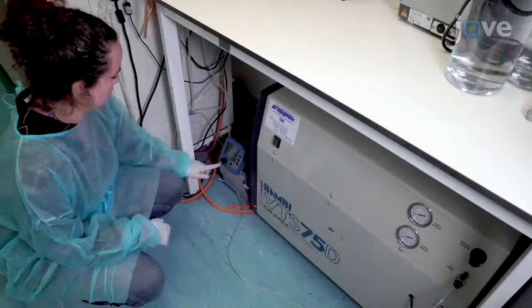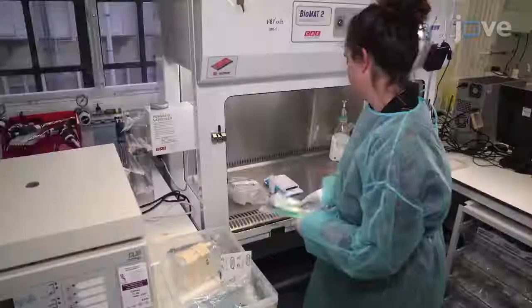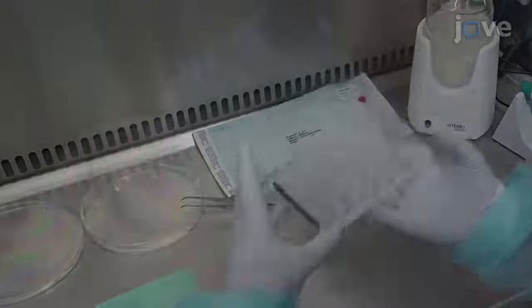First, turn on both the compressor and the vacuum pump associated with the liver chip platform. Proceed to a class 2 cabinet to assemble and equilibrate the plates. Place a sterile membrane on the plate base to begin aseptically assembling the microfluidic plates, making sure that the sterile membrane is correctly positioned.